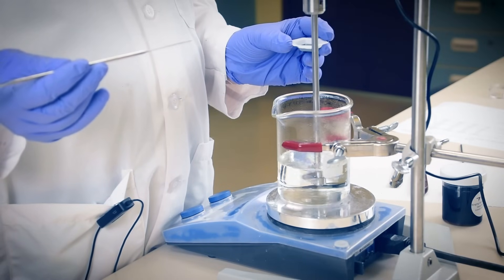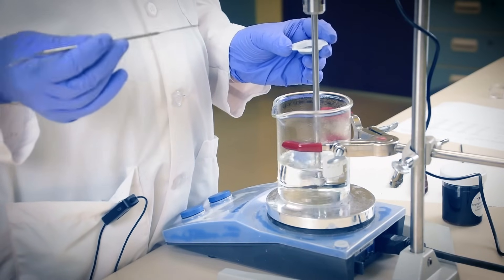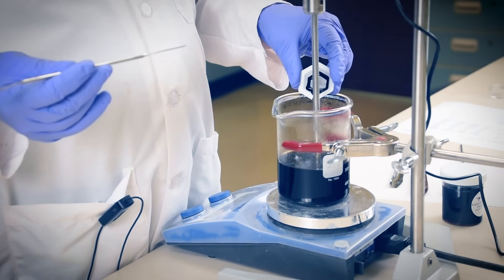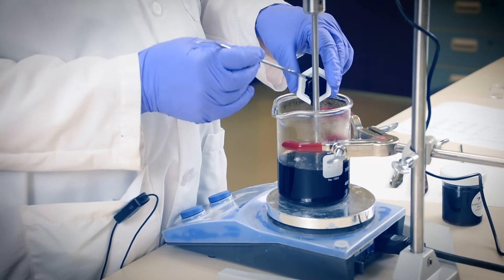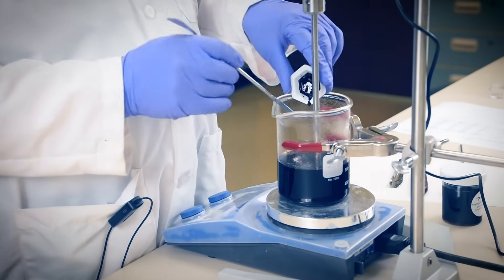To get started, we'll first disperse into the deionized water the caramel colorant DSL4 from Roquette before adding any other element and heating the mixture to 85 degrees centigrade. Remember, not all liquid caramels are the same — select the right one for your application as chemical compatibility is a consideration.